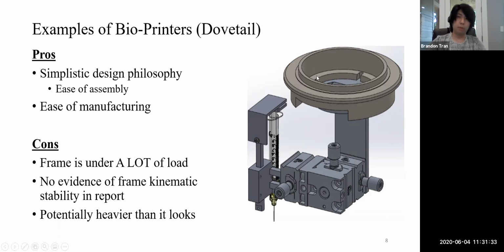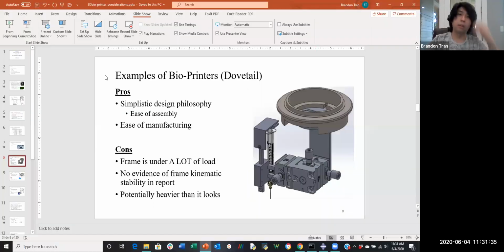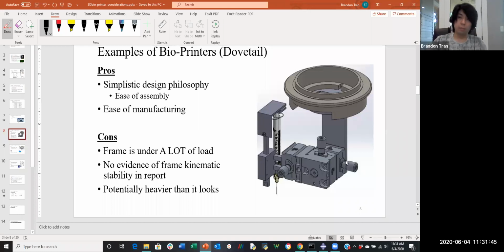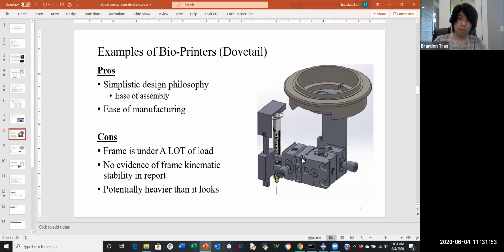This is probably the point where I'm going to exit the PowerPoints because I don't really have any other animations after this. So I'm going to do what I was planning on doing and start doing some drawings. But yeah, with this dovetail, if you can see, the primary load, probably the center of gravity, is located somewhere around this area right here. With that being said, if you guys remember what shear center is, this dovetail, regardless of how fast or slow the motors move and how the module might not conduct too much torque, there are some instances of torque being influenced.